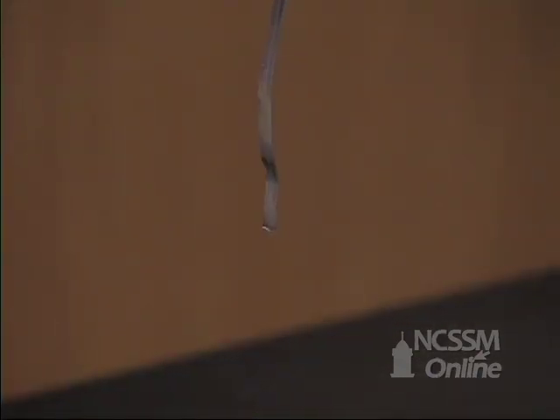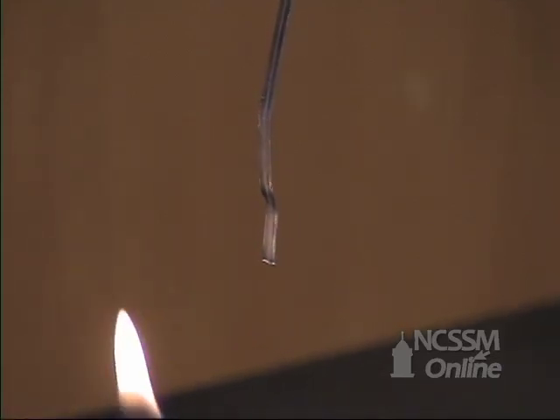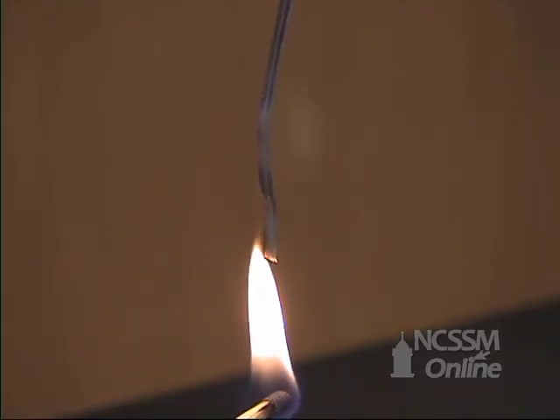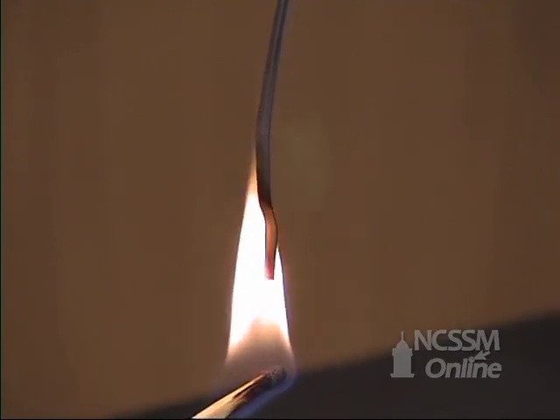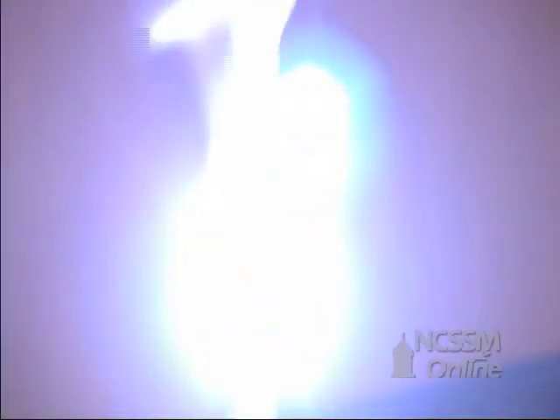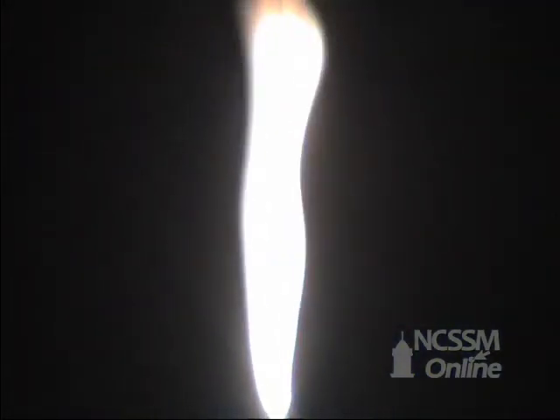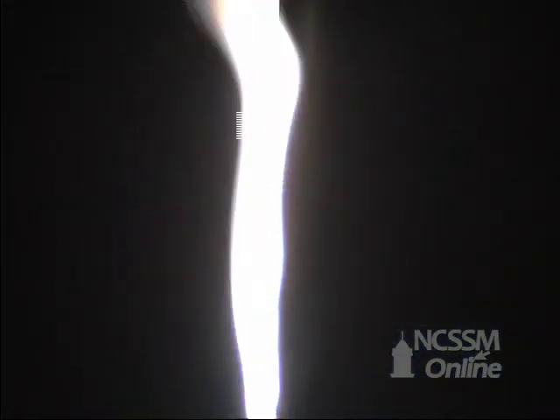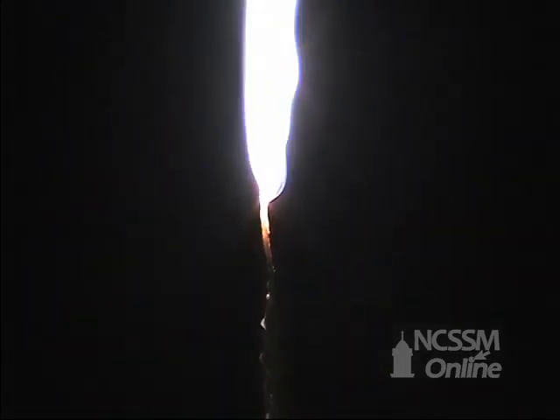At room temperature, the magnesium does not react very rapidly with the oxygen in the air. If we bring in a little bit of heat, the magnesium rapidly reacts with the oxygen in the air. The reaction is very exothermic, as you can see from the light emitted.